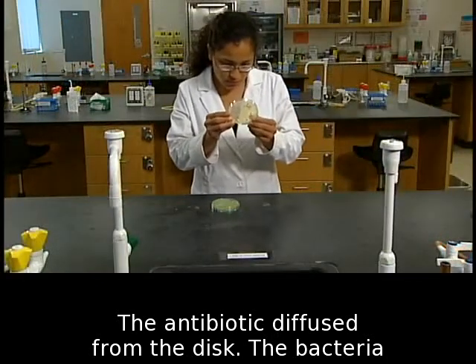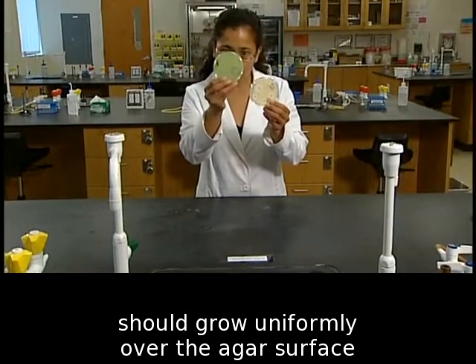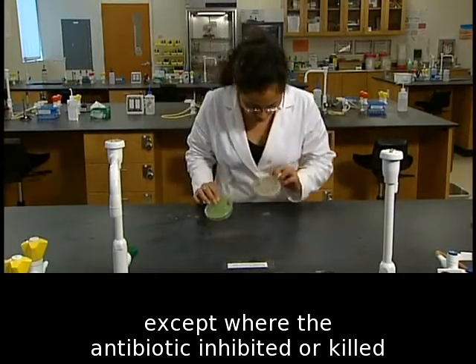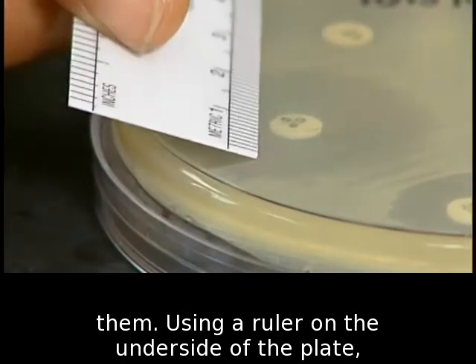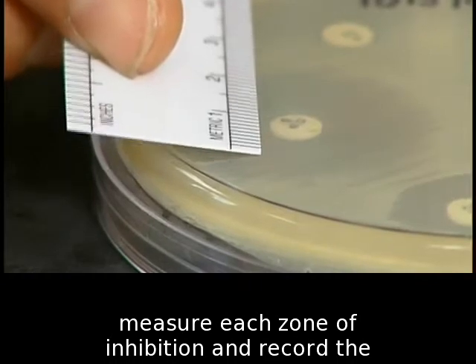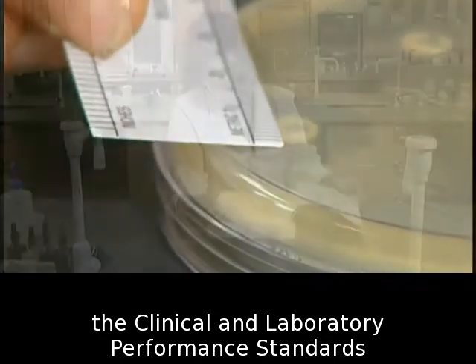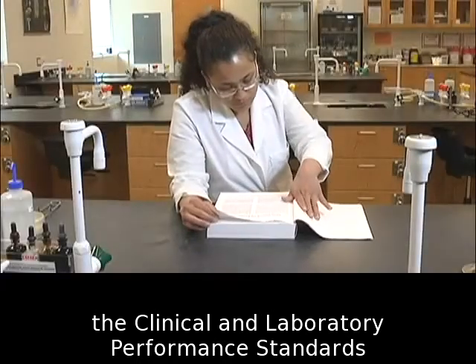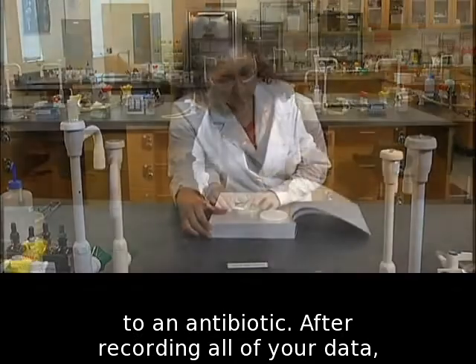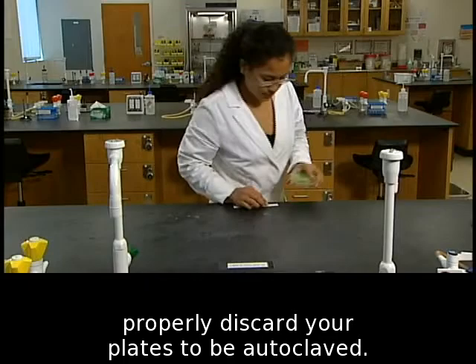The antibiotic diffused from the disc. The bacteria should grow uniformly over the agar surface except where the antibiotic inhibited or killed them. Using a ruler on the underside of the plate, measure each zone of inhibition and record the size of each zone. This value can be compared to the clinical and laboratory performance standards to determine whether the bacterium is susceptible to an antibiotic. After recording all of your data, properly discard your plates to be autoclaved.